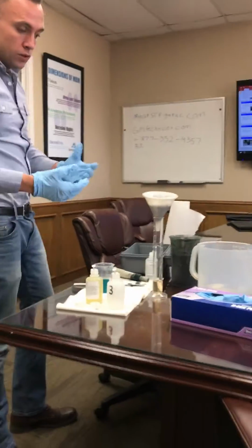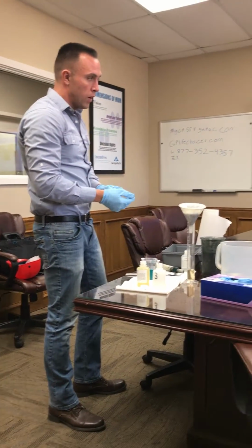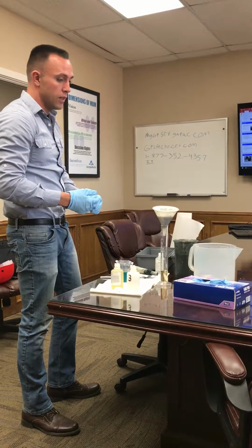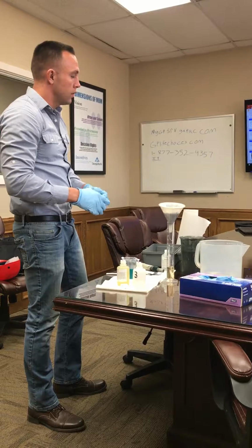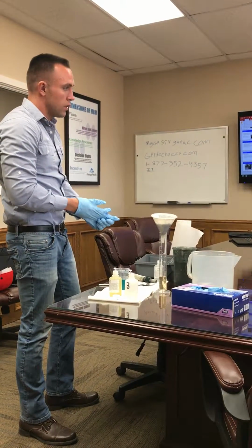That's basically jar testing 101. Without this, you really won't know how much chemicals to use in your 5,000 gallon batch system. If you're doing that in automatic, you have to make those adjustments, or whatever your dropper is, and then let it do its thing.